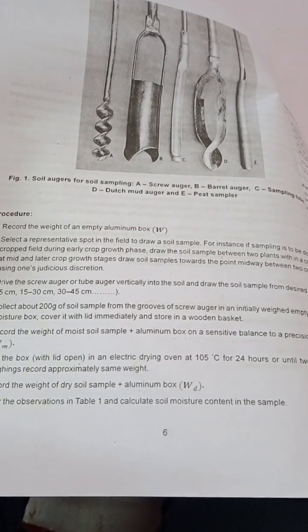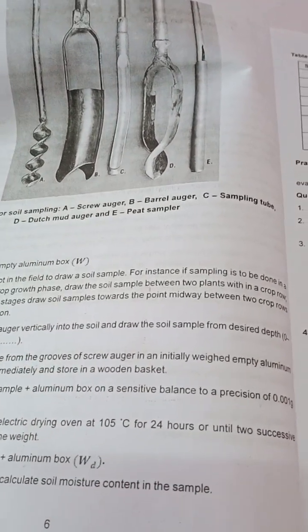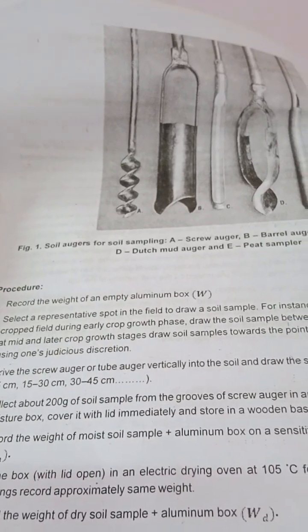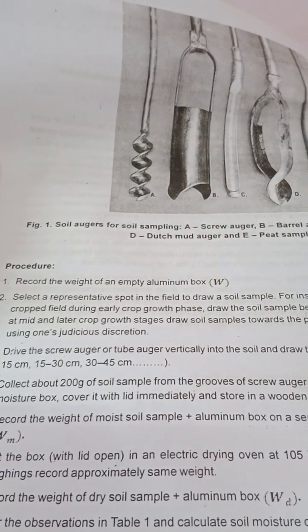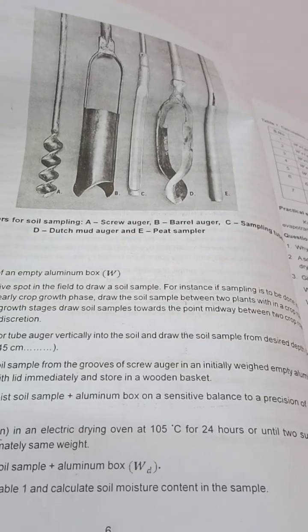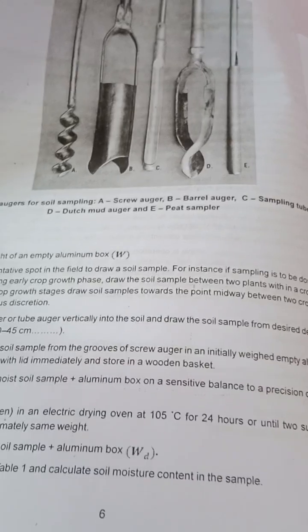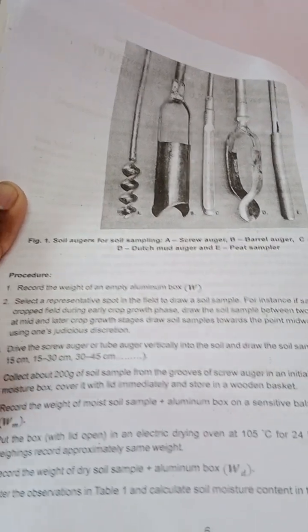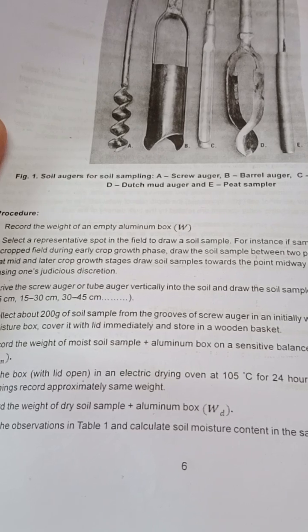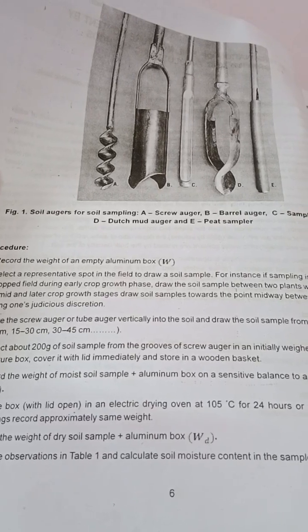Procedure: Record the weight of an empty moisture box. Select a representative spot in the field to draw a soil sample. If sampling is done in a cropped field during early crop growth phase, draw the soil sample between two plants within a crop row. At mid and later growth stages, draw soil samples towards the midpoint between two crop rows. Drive the screw auger or tube auger vertically into the soil and draw the soil sample from the desired depth — 0 to 10 or 15 cm, 15 to 30 cm, 30 to 45 cm. Collect 200 grams of soil sample from the grooves of the screw auger into an initially weighed empty aluminum moisture box, cover it with a lid immediately, and store in a wooden basket.